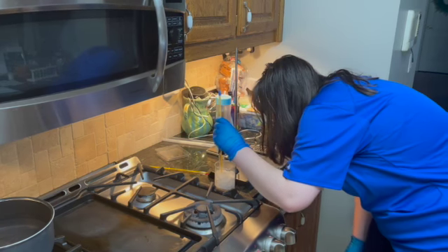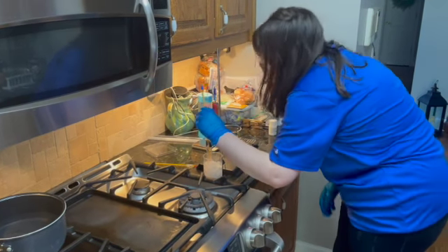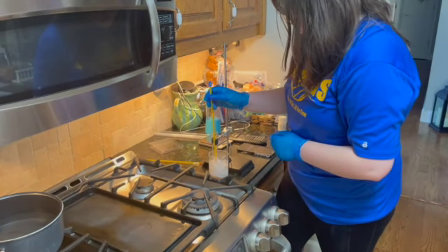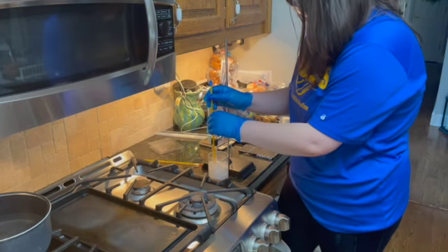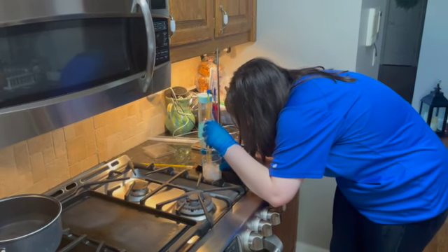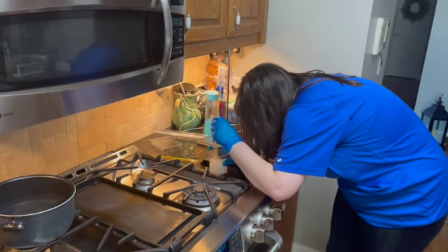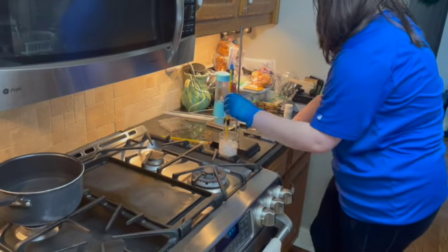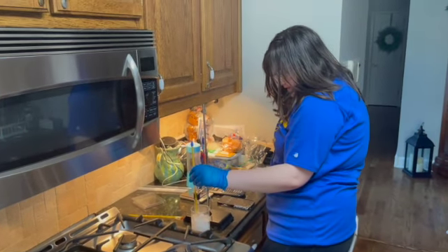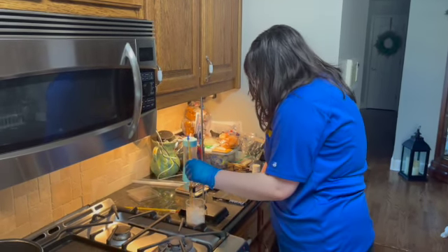Okay, we are at the 3-minute mark, and it has gone down now to 49 degrees Celsius. And our ice is still looking good. I'm looking down at it, just making sure I can tell. Like I said earlier, around the sides have gotten pretty white and have become solid, but of course we're going to have to wait for the middle too. And when looking at it around the sides, it's more freezing outward in, from what I see.